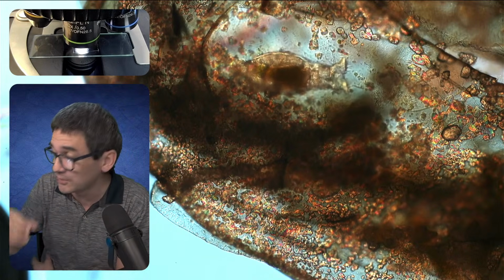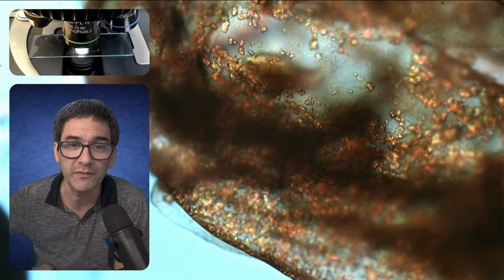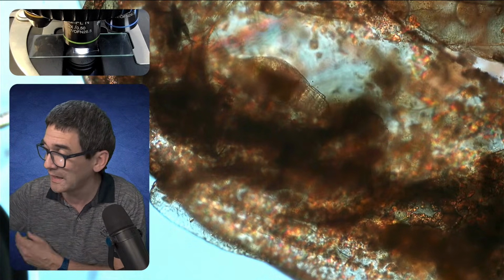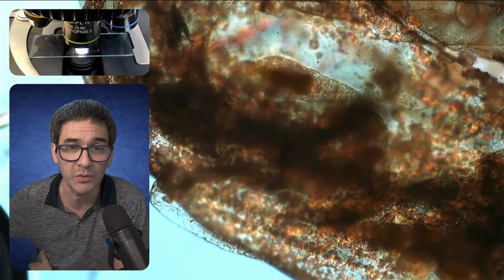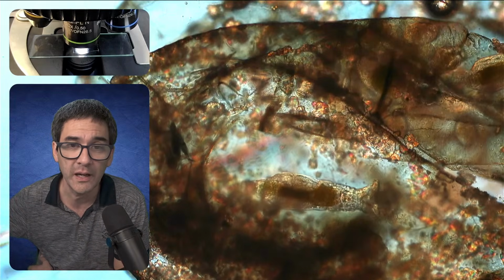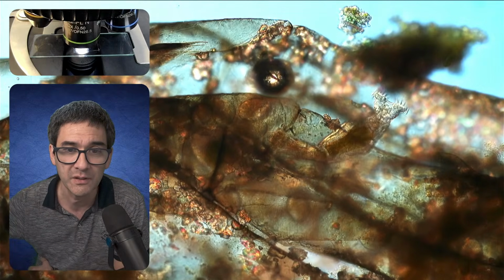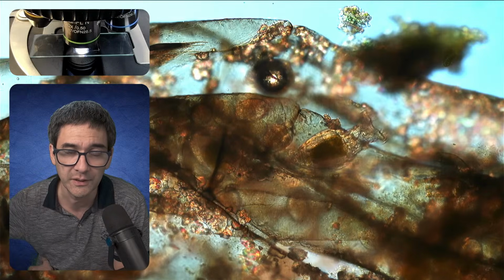Okay, so it's correct that normally moss should be very wet, but it's normally not completely submerged. But this one actually was floating in the water, and this is why I collected it, because I was kind of hoping to see certain organisms sitting on it, growing on it, and this is actually what we're able to see here, right?